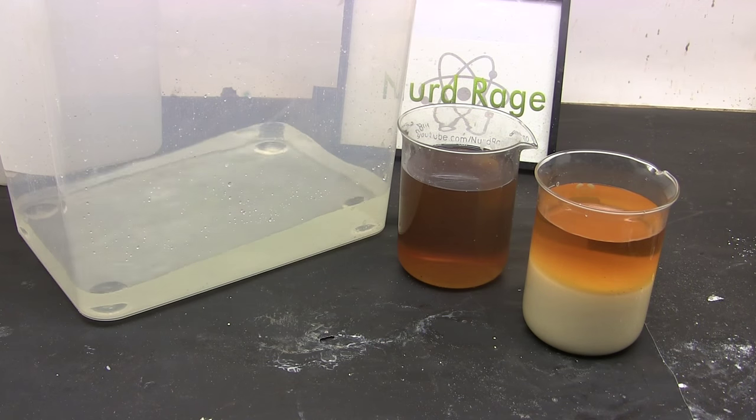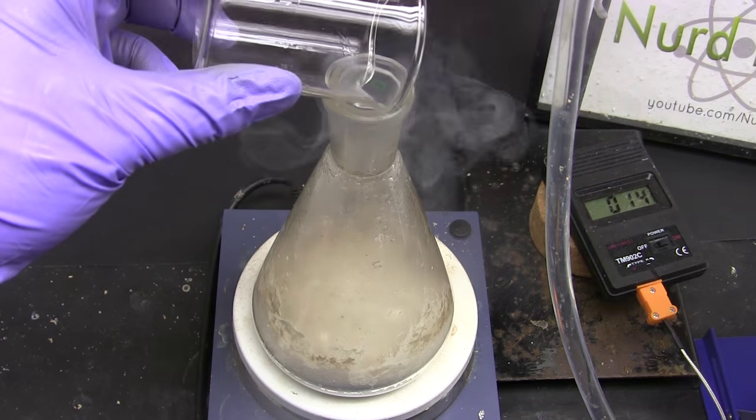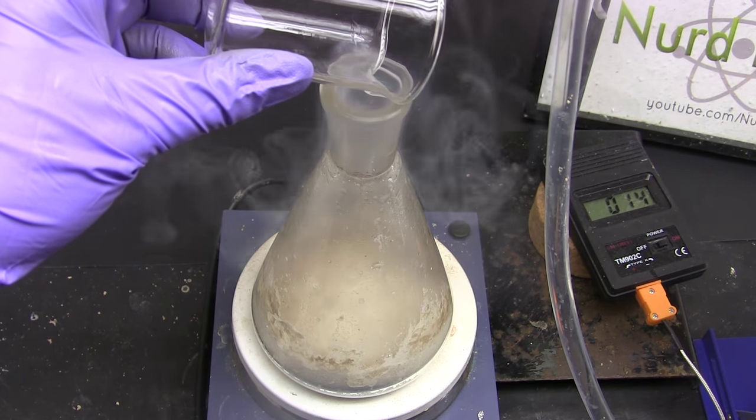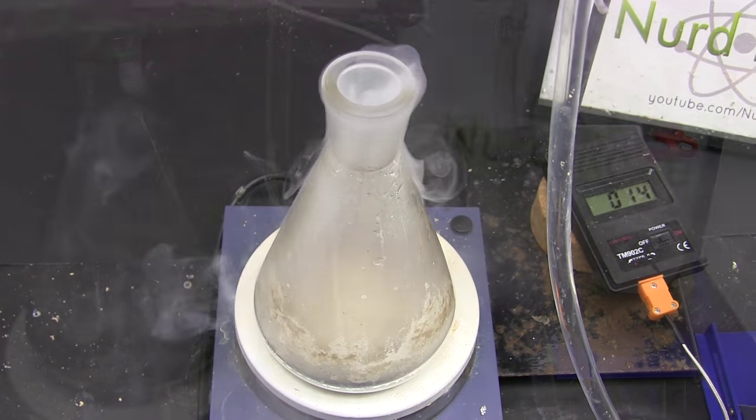This is because as we've shown there is a tremendous amount of salt in it so we need a huge amount of sulfuric acid to react out. If sulfuric acid is dirt cheap to you then you can go that route if you want. Just remember that hydrogen chloride will also be released and you'll need to deal with that. Anyway, keep distilling until nothing more distills over.